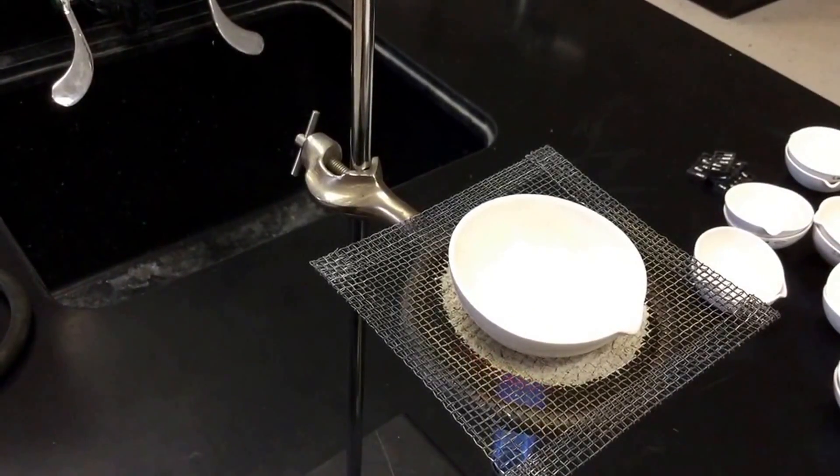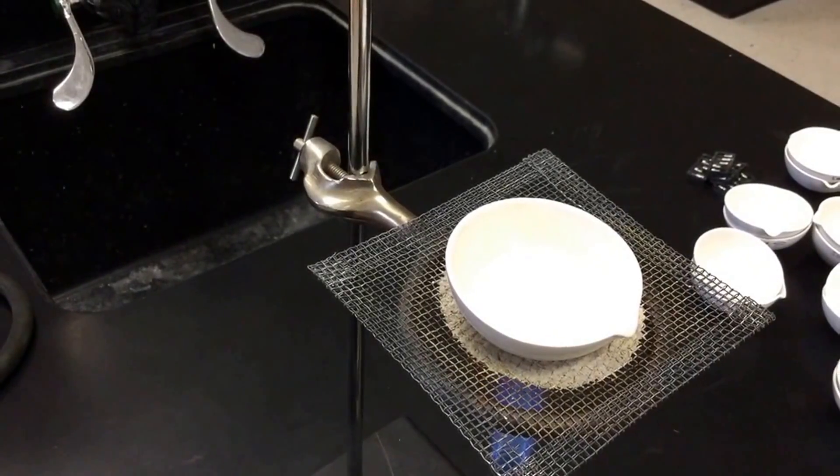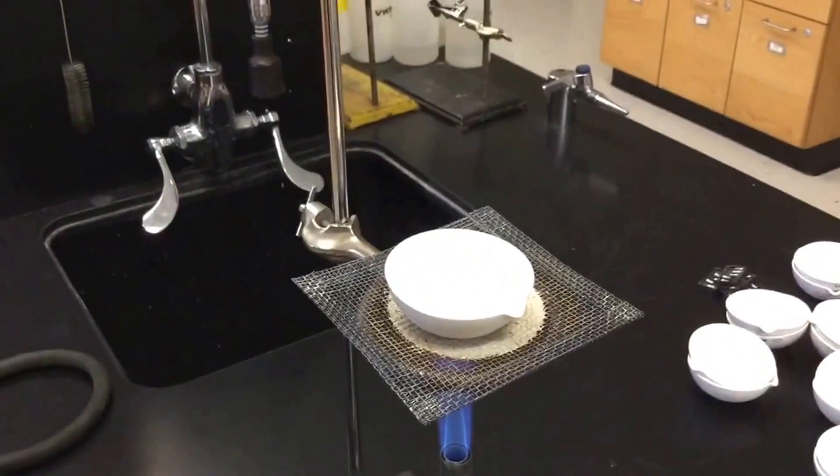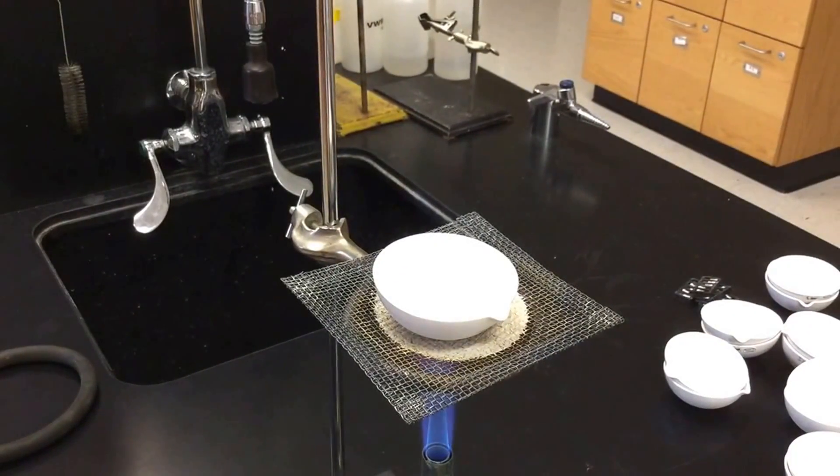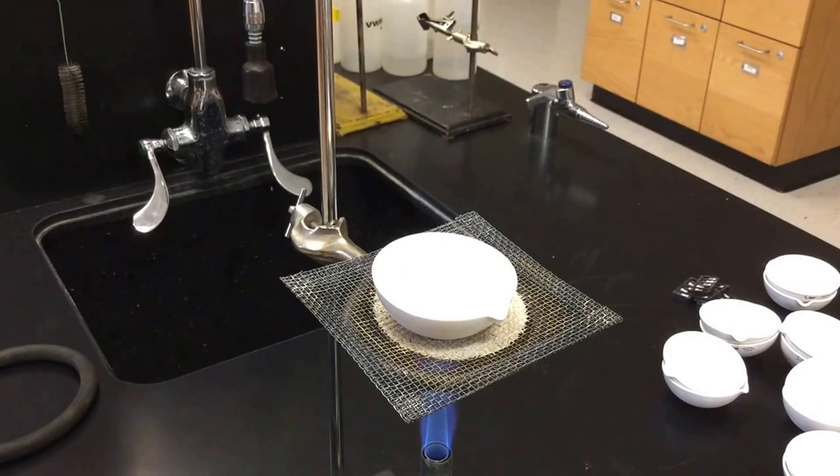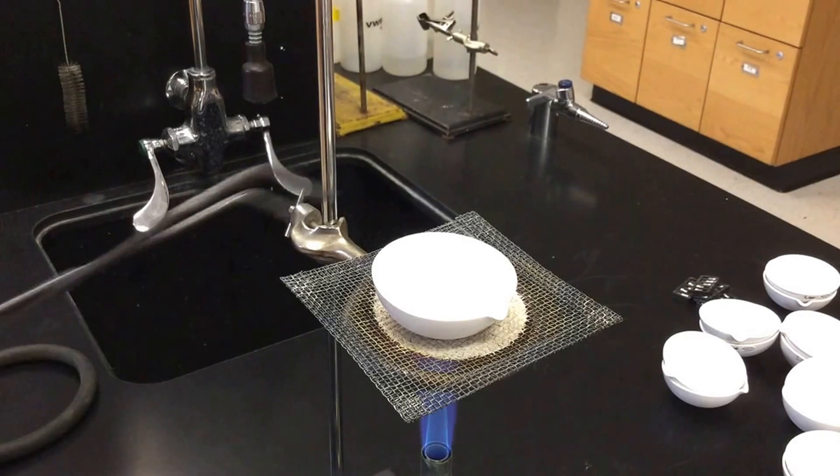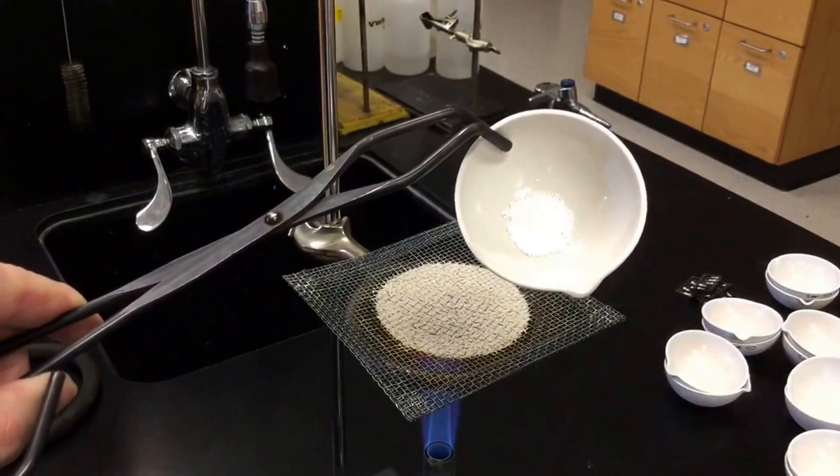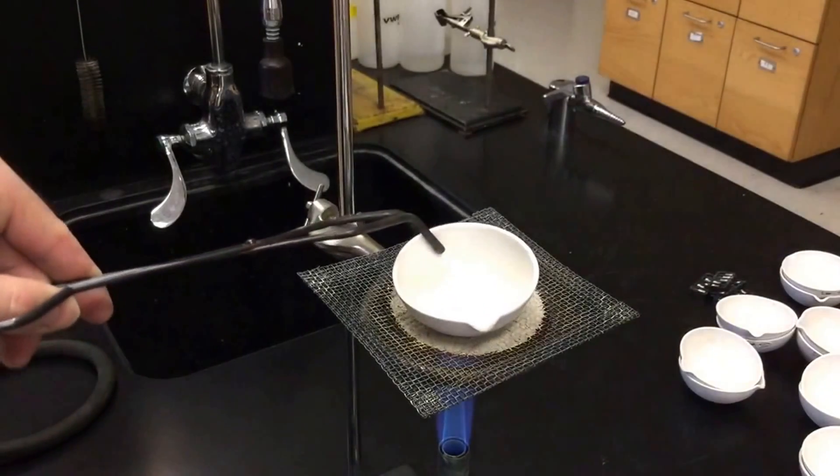That's a good indication that we have something happening as it heats and cooks away. As it heats, like I mentioned, the chemical is going to sort of harden. We'll notice the texture is going to change. As it hardens, it forms a clump. And so as we heat this or as it forms the clump, what we'll do, I'll see if I can turn this so we can see this a little bit better. You can see it there a little bit. It's going to change its texture there.